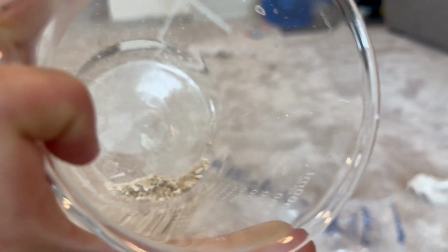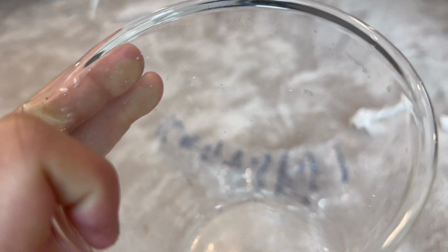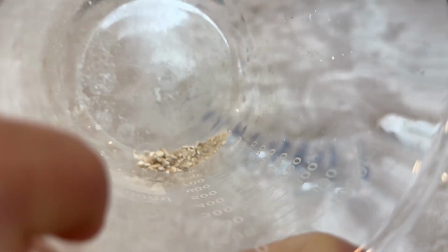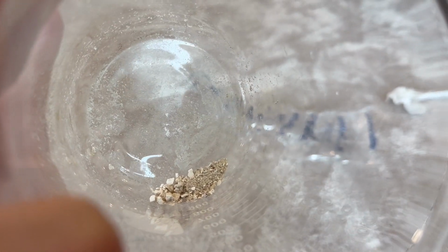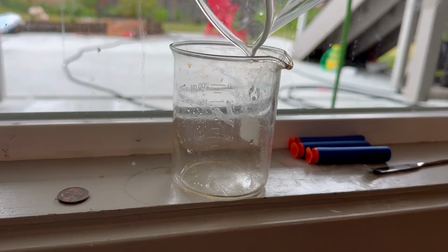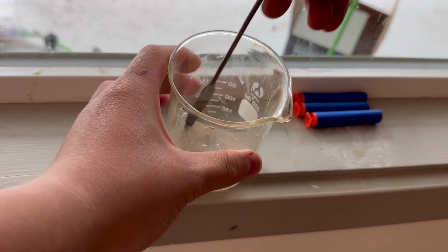Alright, so this is the result. You can see the splotches where the glass looks dirty. That should be phthalic anhydride. Unfortunately, there's not enough to collect. And all this stuff is absolute crap salt. Yeah, that's fun, I guess. Yeah, I'll try one more idea, but after that, I'm out of ideas, and hopefully there's some phthalic acid in this mess. My final idea was to try dissolving the phthalic acid and anhydride in acetone, as the potassium crap was insoluble.